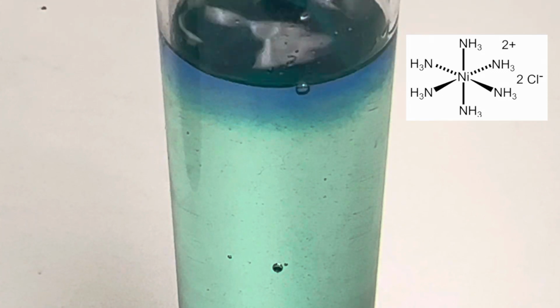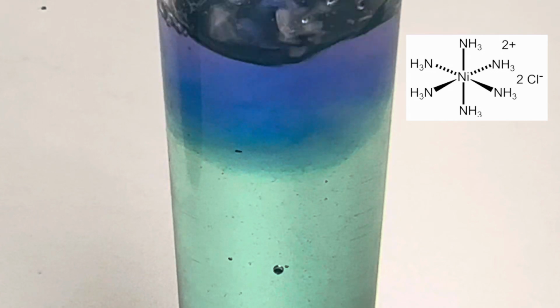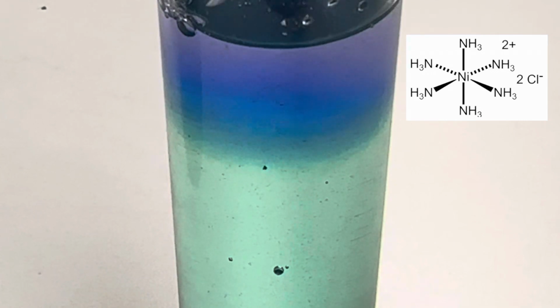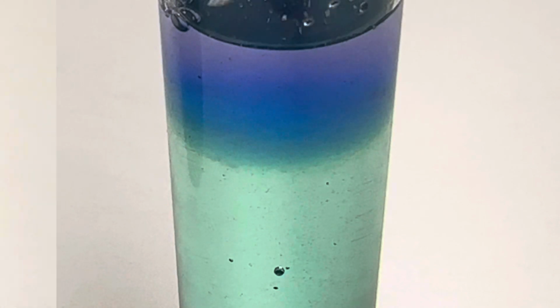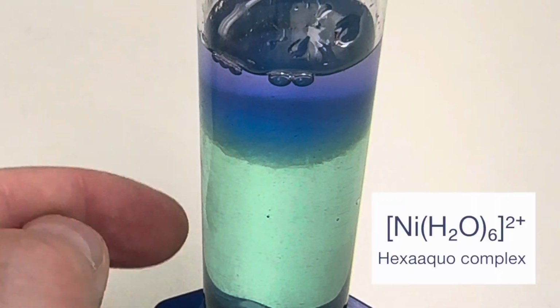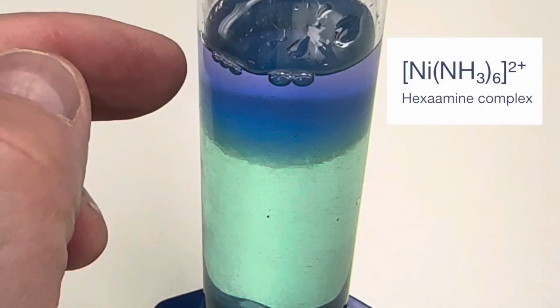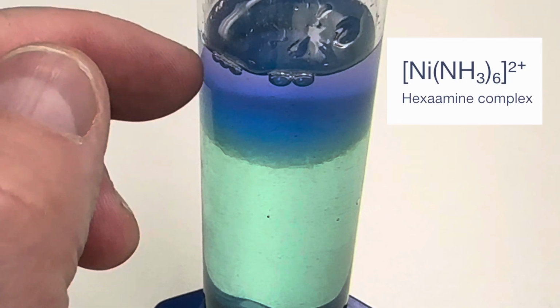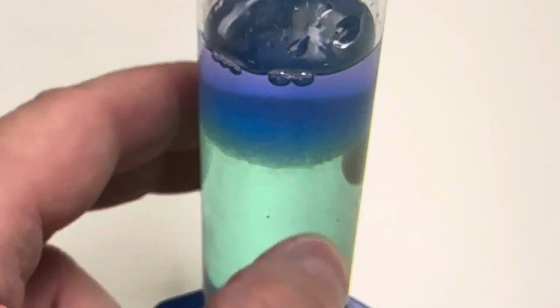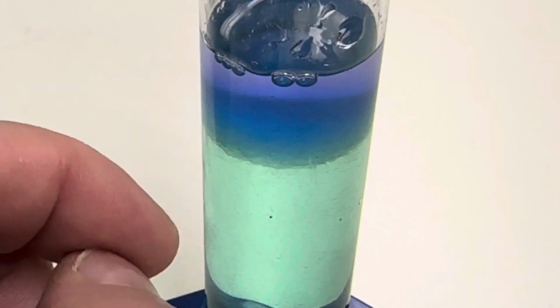Look at that beautiful blue color change. Isn't that amazing? So here we can see the hexahydrate solution, and up here that ligand exchange creates the hexaamine solution up here where you have that deep purple color. So I can reverse this reaction by adding hydrochloric acid.